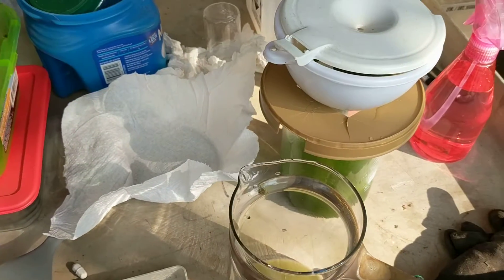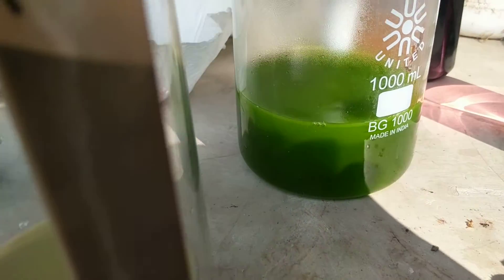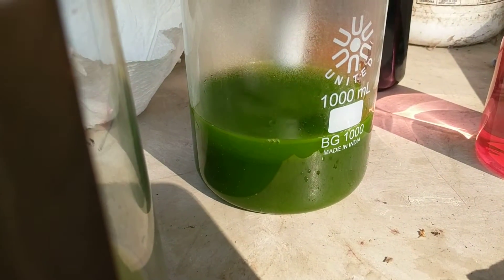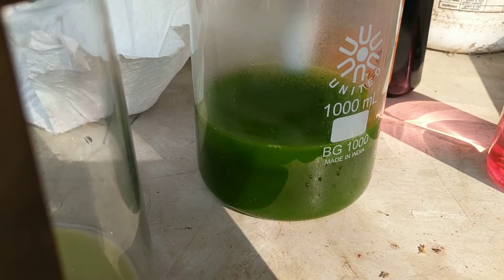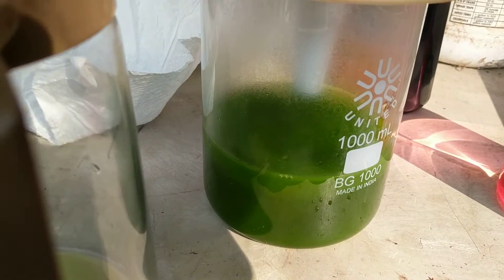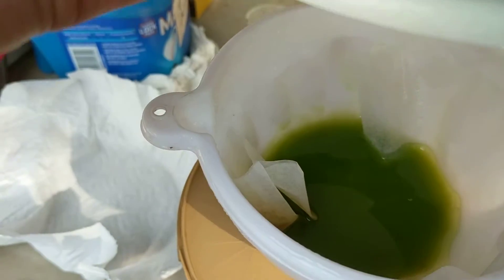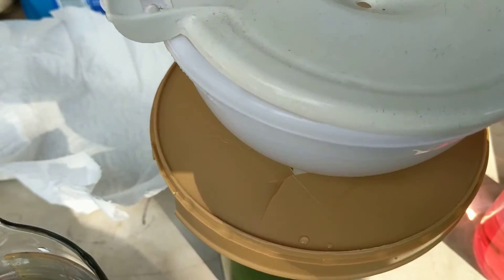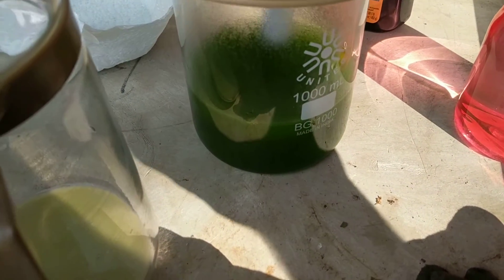I decided to filter this — can you see that double line there? The sulfates are coming over with it. There were some solids on the bottom, and for some reason I just rinsed it right in and I shouldn't have done that. So this is gonna take a minute, but we're back in the game. I'm gonna filter this probably run it through the filter one more time just to make sure.